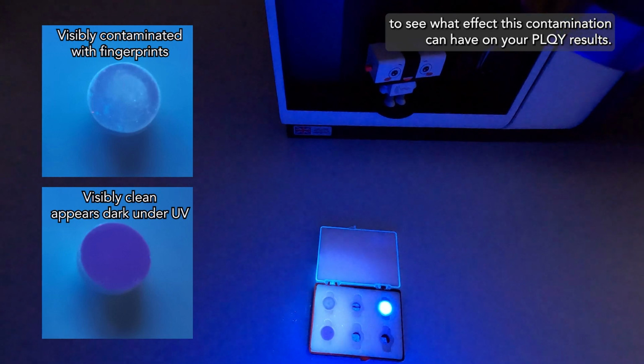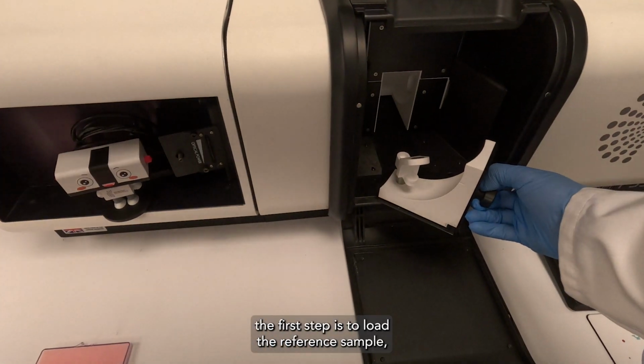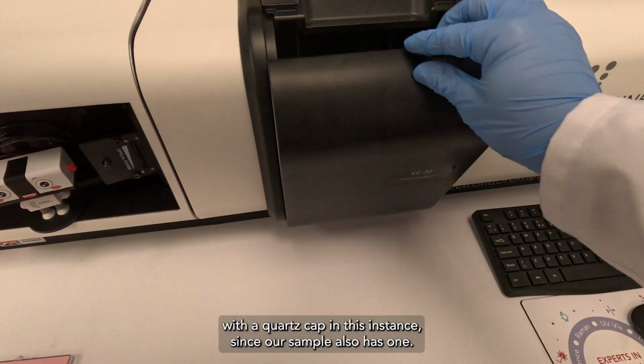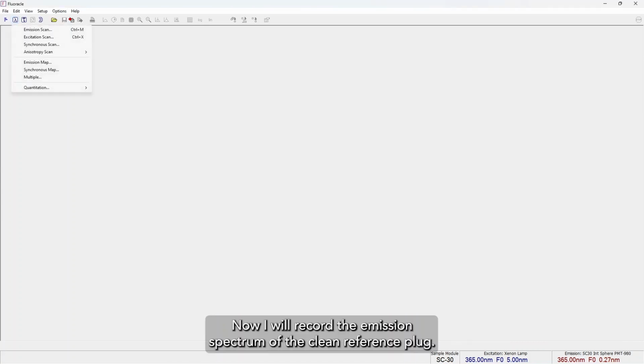on your PLQY results. As with every PLQY measurement, the first step is to load the reference sample, with a quartz cap in this instance since our sample also has one. We then launch the signal rate screen and select appropriate excitation and emission bandwidths to avoid saturating the PMT detector. Now I will record the emission spectrum of the clean reference plug.